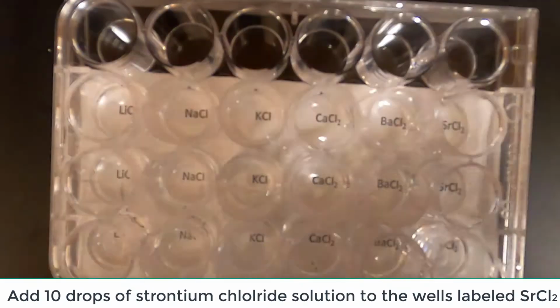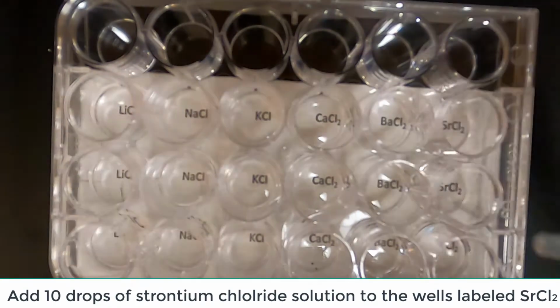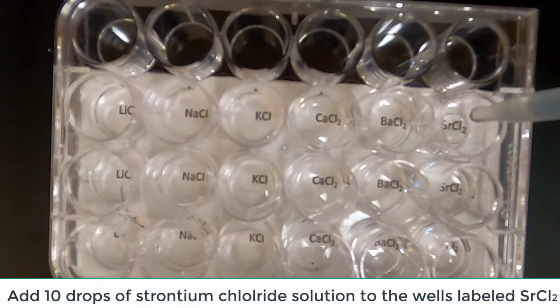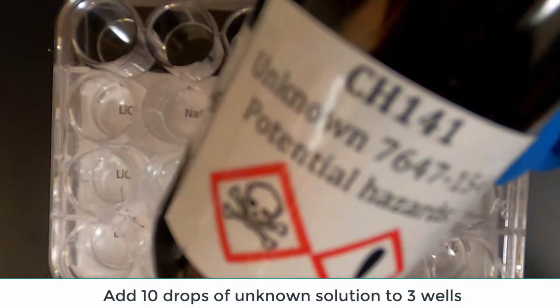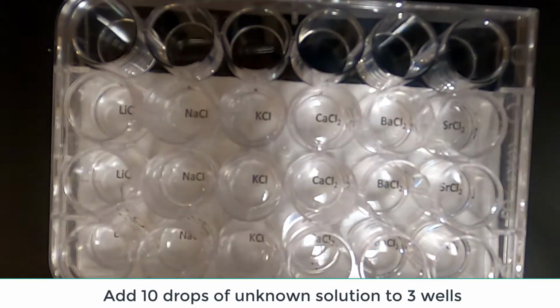Into each of the 3 wells labeled strontium chloride, add 10 drops of strontium chloride solution. Into each of the 3 empty wells, add 10 drops of the unknown solution.